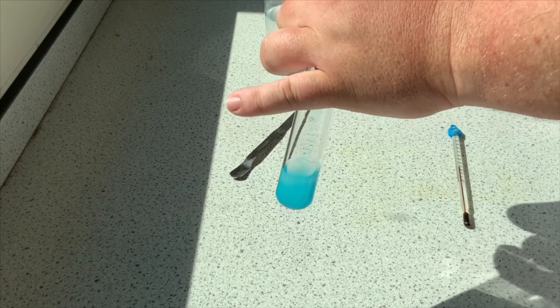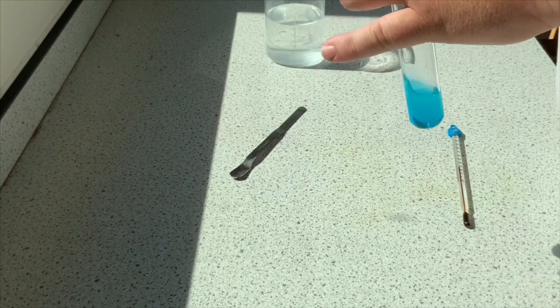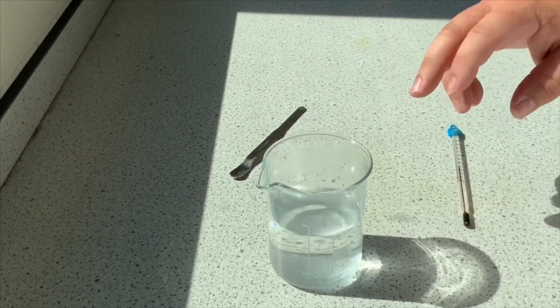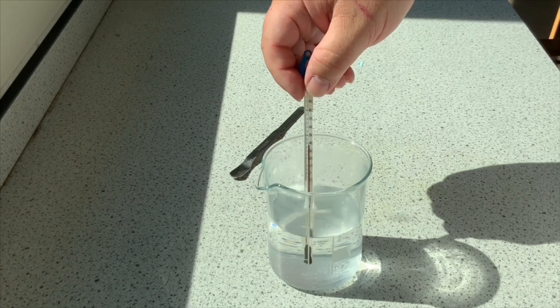What you want to be able to do is stick it into a water bath at about 75 degrees and you want to have it in there for about five minutes. So here's my water bath. It's already slightly warm; you can see the temperature starting to rise there already.